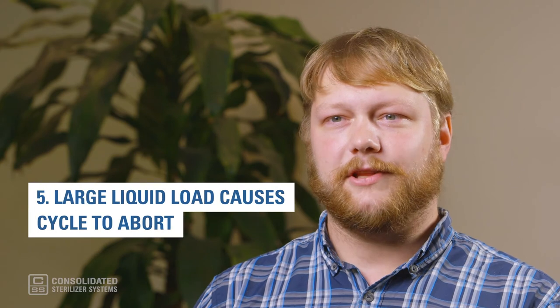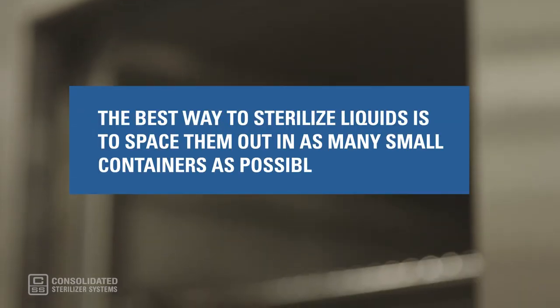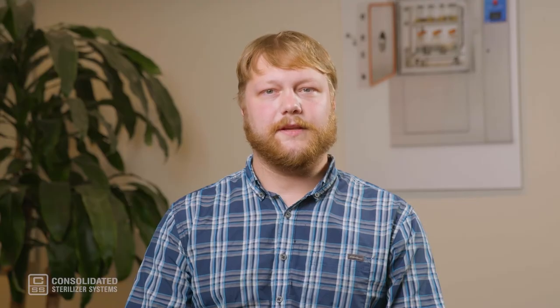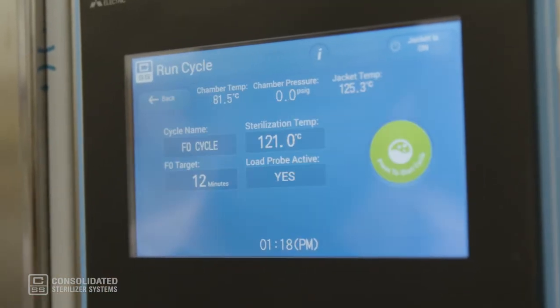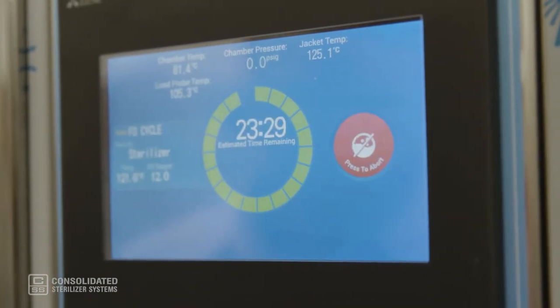The sterilizer simply pulls the vacuum inside the chamber and evaporates any remaining water. Now onto problem number five: a large liquid load causes the sterilization cycle to abort. Large liquid loads take a long time to heat, which can cause sterilization cycles to abort. The best way to sterilize liquids is to space them out in as many small containers as possible. Another way to prevent this problem is to use an F-sub-zero cycle, which enables the autoclave to count the time that it spends heating up the water towards the total sterilization time.